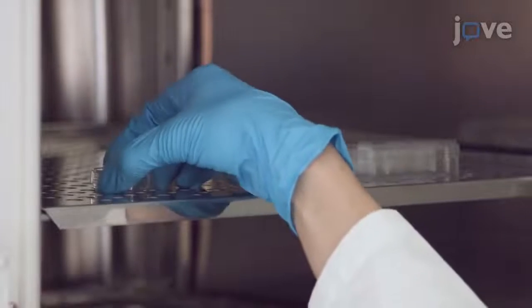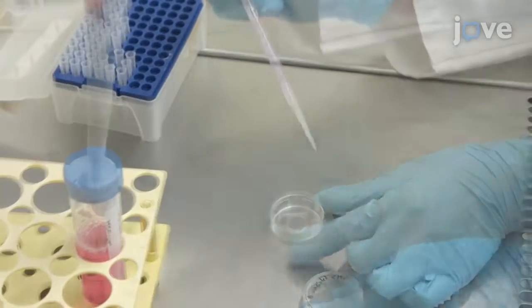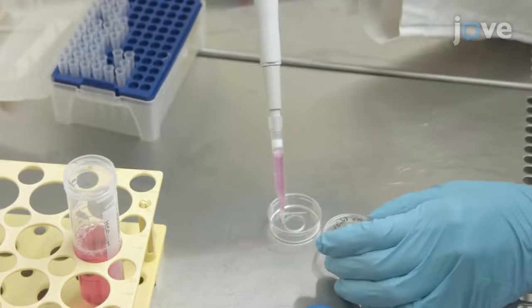Culture the infected cardiomyocytes for 12 hours at 37 degrees Celsius, and replace the infection medium with fresh cardiomyocyte maintenance medium.